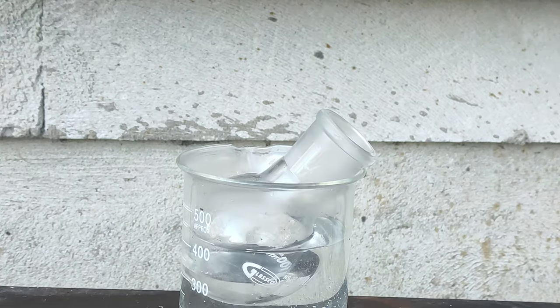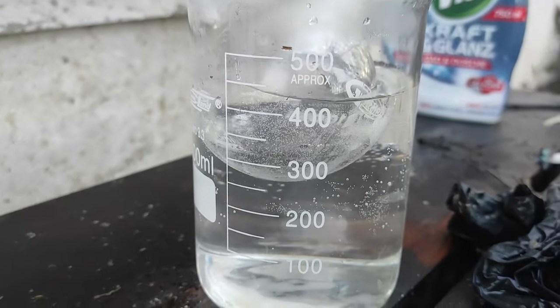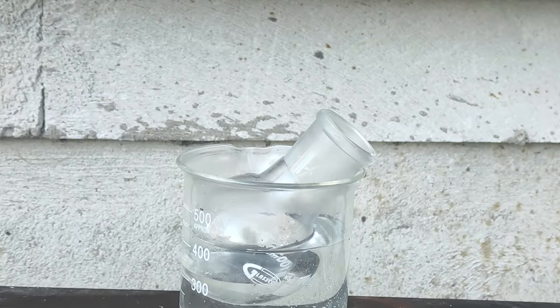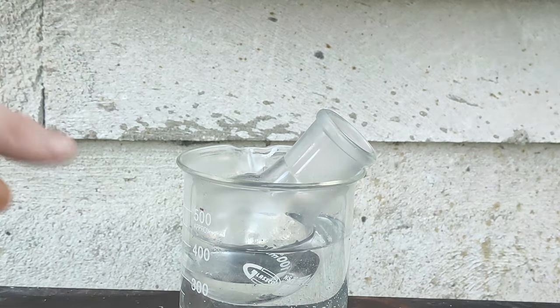I went ahead and placed it in mildly hot water. It may be hard to see, but those bubbles are from the ether being evaporated. I've left it for an hour to make sure all of the ether has evaporated.